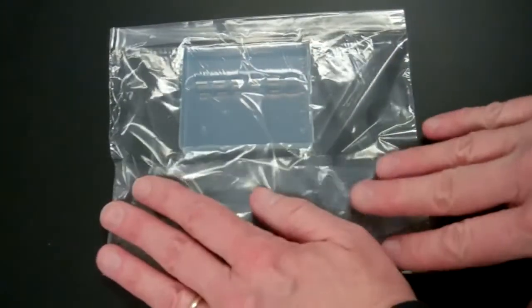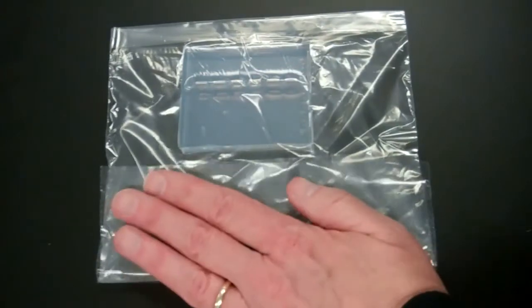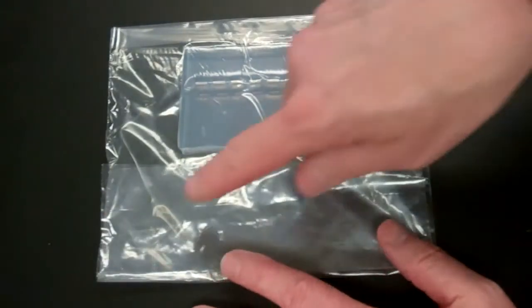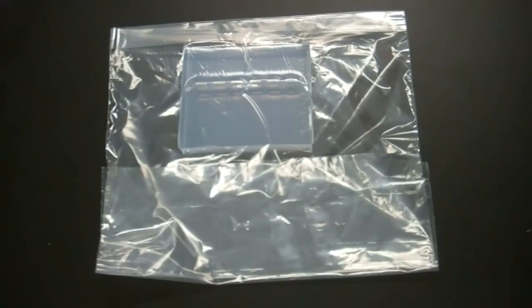And if you haven't labeled it already, you can label it right now with your name and the use of this gel.